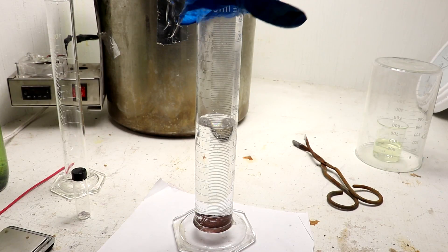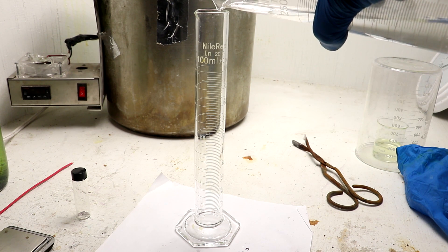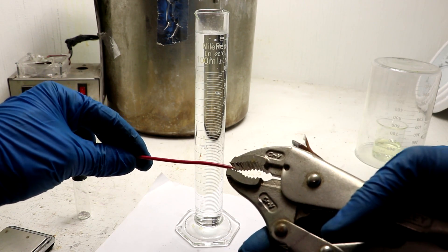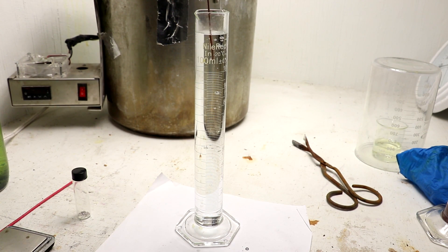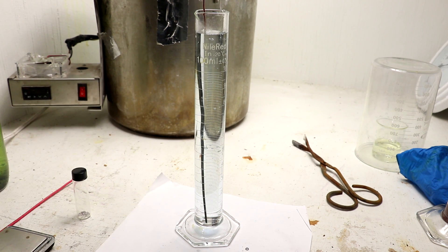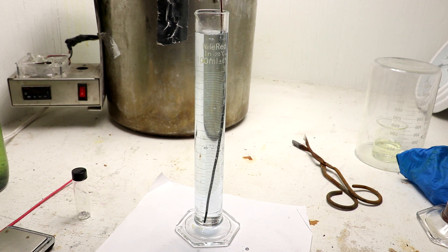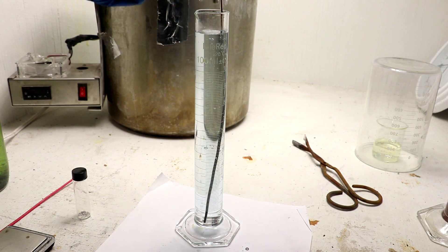It's been a few days and the silver is finally dissolved. Let's decant off the clear liquid that should contain just the silver chloride ammonia complex. Now we want metallic silver, so I'm going to do a displacement using a piece of copper wire — copper will displace the silver, leaving silver metal. You'll notice the solution is actually turning a bit blue — copper chloride and ammonia is a vibrant blue color. I'll just let that sit for another few days, and put a cover on to keep the ammonia from evaporating.